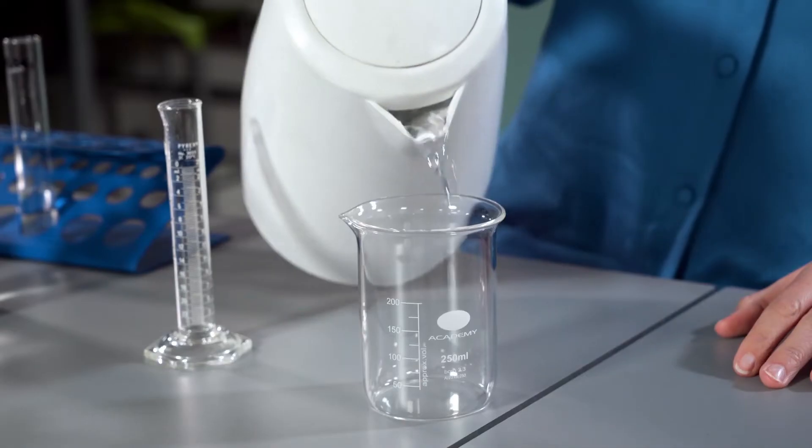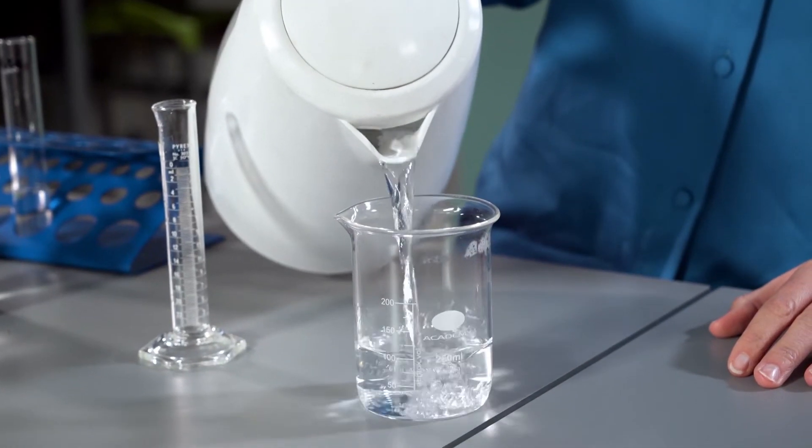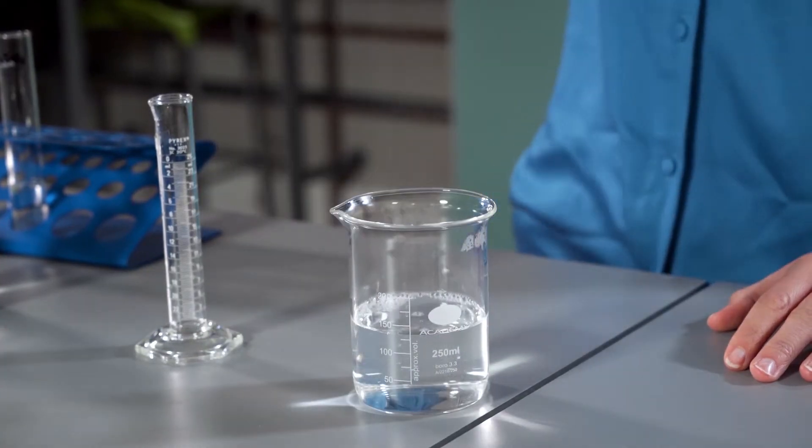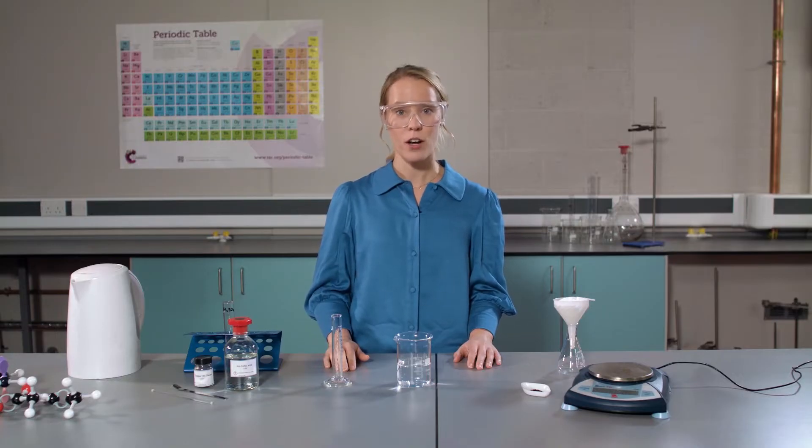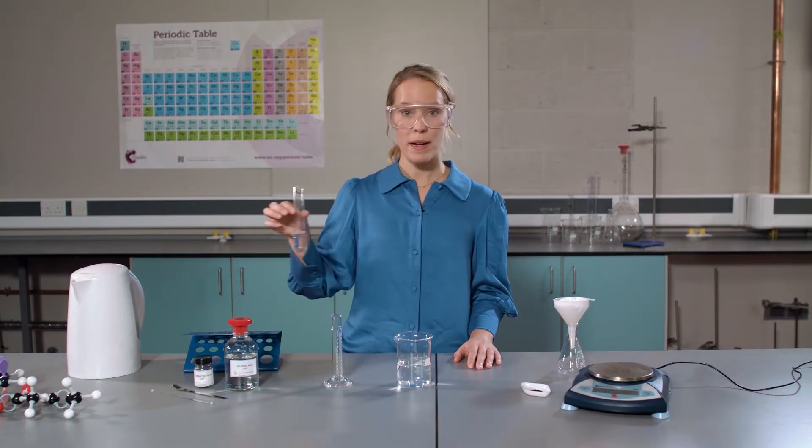Next, I'm going to half fill this beaker with hot water from a ready boiled kettle. Now I will gently stand the boiling tube in the hot water for about two to three minutes.